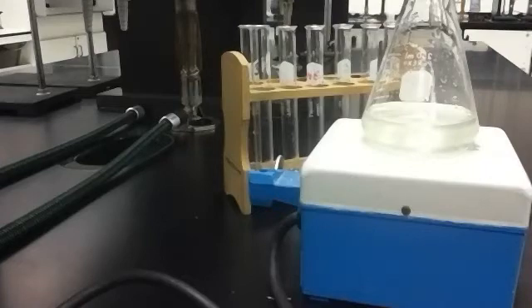The color change indicates that enough iodine has formed. We'll add some more stuff, and that sends it back into the ion phase. So the color is going to go away. And then the reaction takes place even more, and the color change comes back. Then we add another test tube, and the color change is going to go away. So that's kind of what to look for.